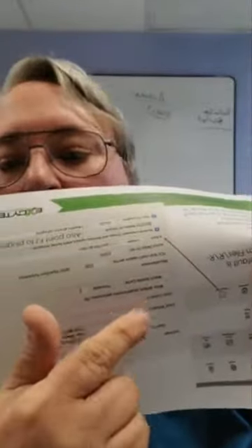And one of the things you have to do when you're setting these scripts up is go over here into the preferences window, under the diagnostic window. I'm not sure why it was put there. There's an option, which I've highlighted here with this red arrow, to point to two factors. One, where the R program is on your computer, and two, where the jar files are on your computer. Now, you need to download the R program, which is free, and put it on your computer, and then you just need to make sure you put the right path in.